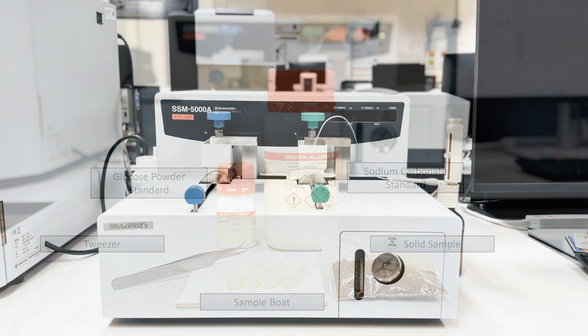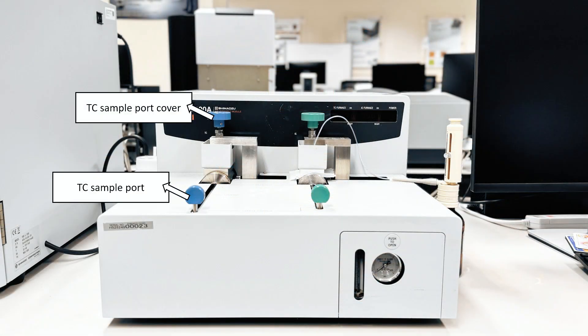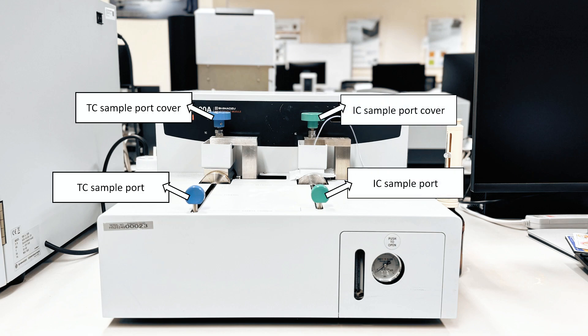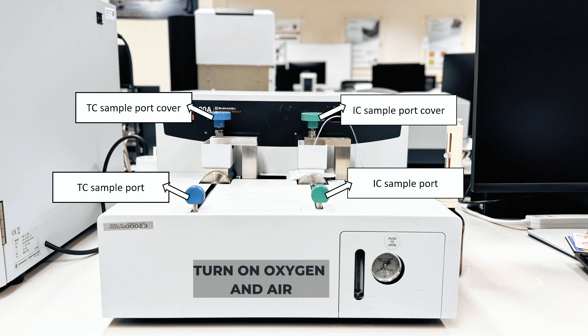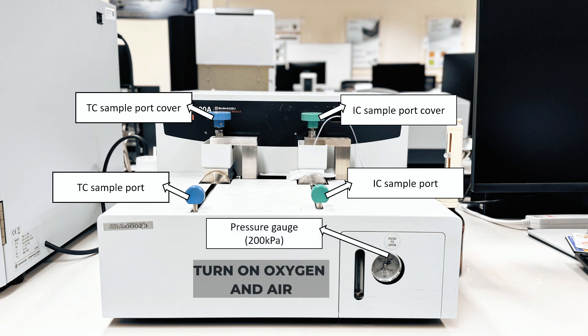This is how the SSM looks: the blue color TC sample port and cover, and the green color IC sample port and its cover. Before analysis, turn on the oxygen gas and air, and set the carrier gas pressure to 200 kPa.